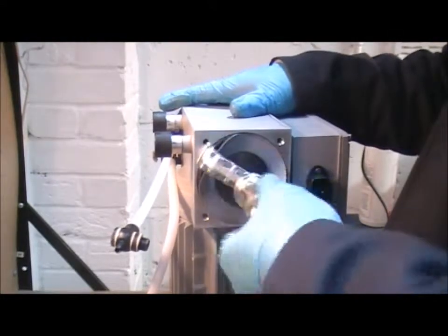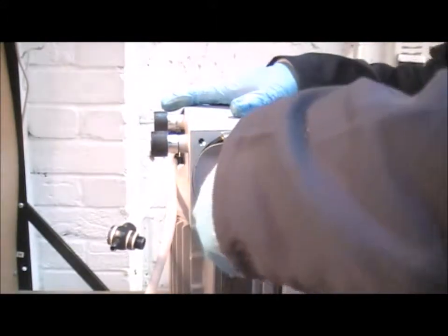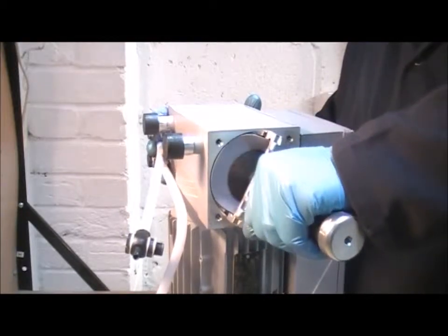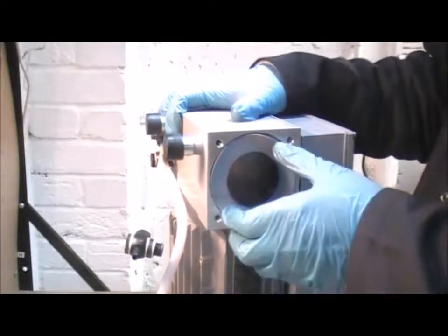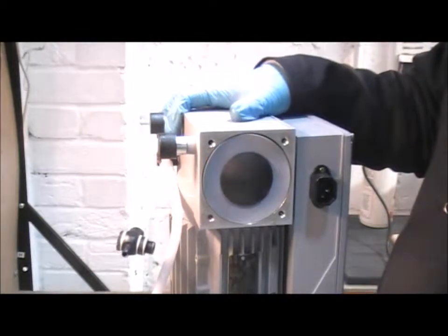And once it starts to lock up, you just want to turn that as tight as you can with one hand. And that'll give you the right pressure. Pull the tool away. And that's a snug fit, ready to refit the head.